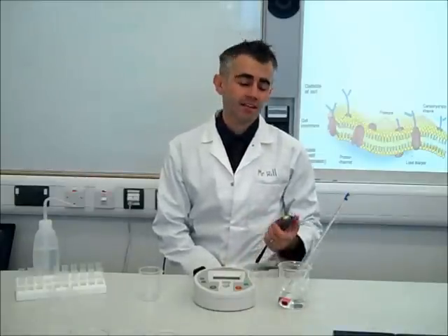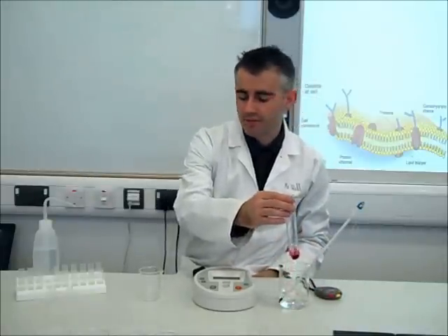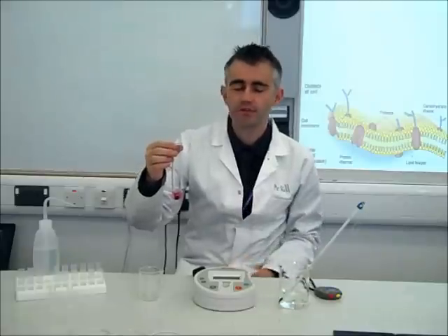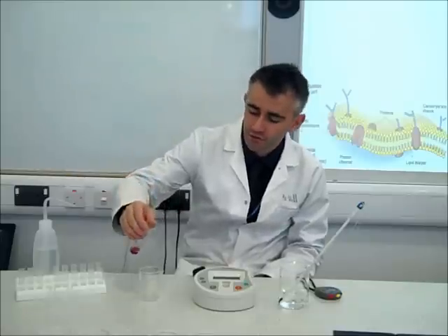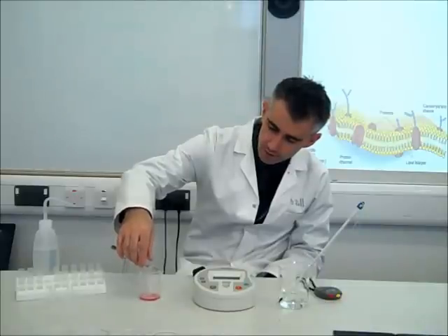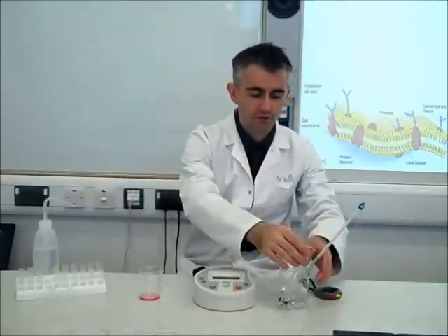It has been exactly 20 minutes since we put the beetroot sample into the five centimetres cubed of distilled water, so it's now time to take it out. Remember, all samples should be removed after the same time period. To remove the beetroot, I tried using forceps but they were too short to reach, so I'm simply going to tip it out into a clean beaker and leave the beetroot piece behind — or remove it from the shallower beaker if needed.